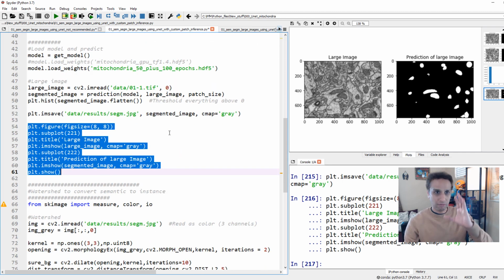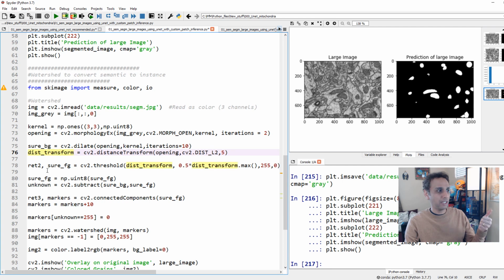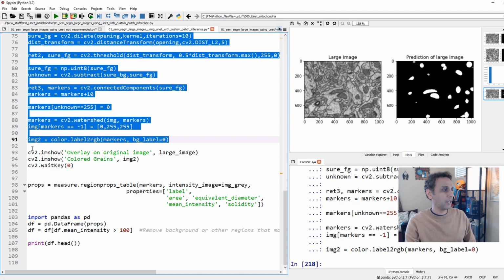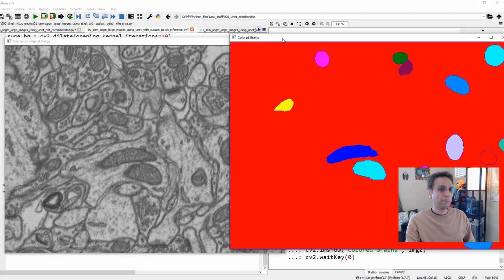Now, at least I hope you're with me until now. And this part, I'm not going to go through line by line. This is exactly what we did in the last video, where we actually did some image processing operations, like performing distance transformation, and then segmenting the images, and defining the sure background and foreground, and defining the unknown region between the background and foreground, so Watershed can actually find this region between these two and then fill it, right? So this is where we're converting our semantic segmentation into instance. So please watch the video exactly before this one. Okay, so let's go ahead and run these lines up to here, where it's performing all of these operations, and it should be pretty fast. And now let's look at the output of this, our instance segmentation result. There you go. So there's our input, here is the output, right?